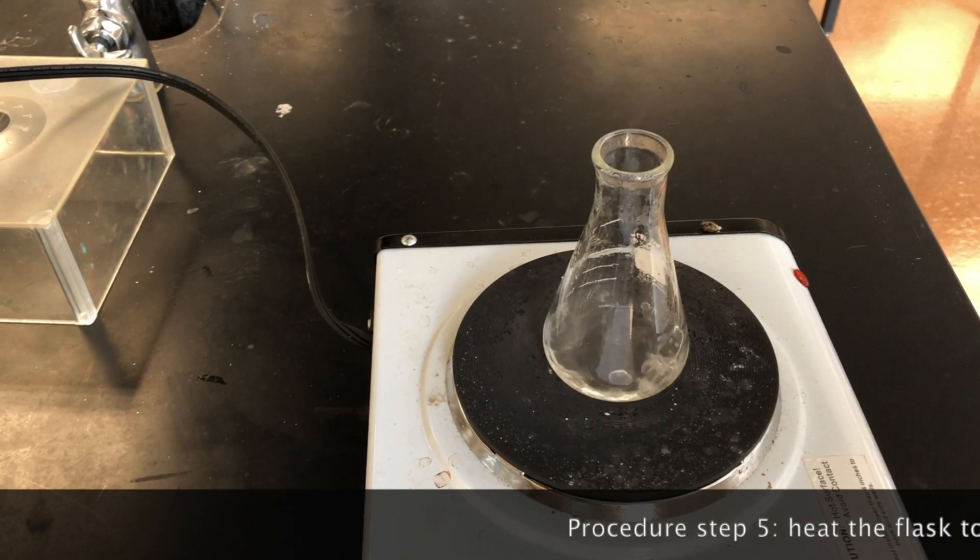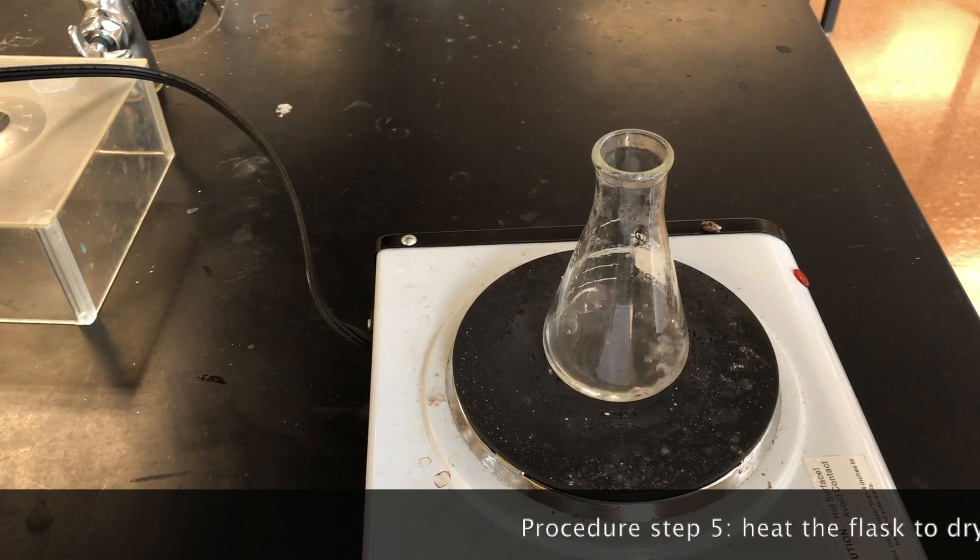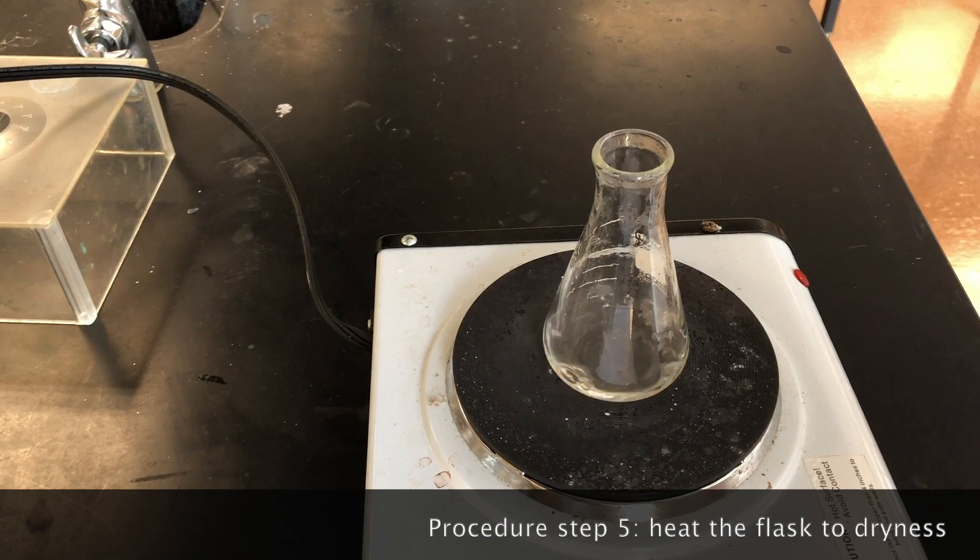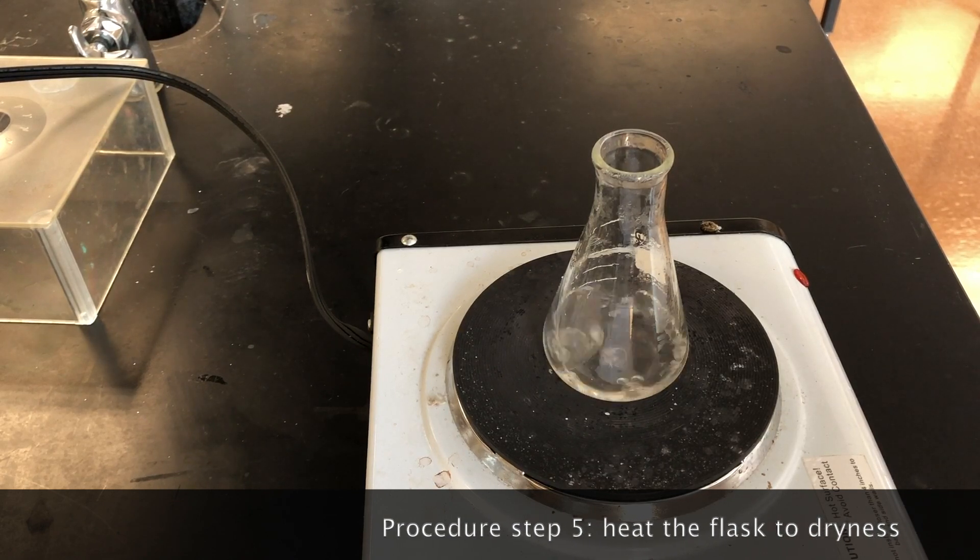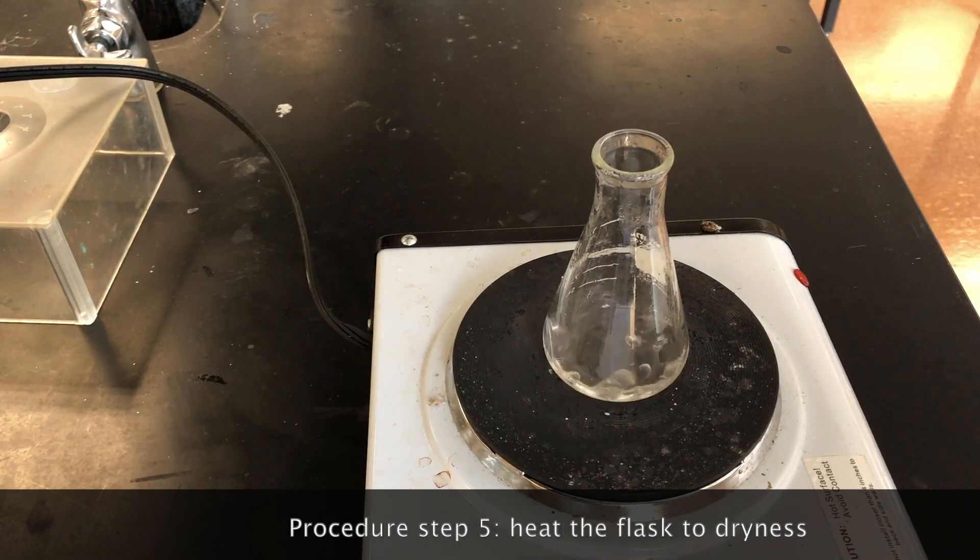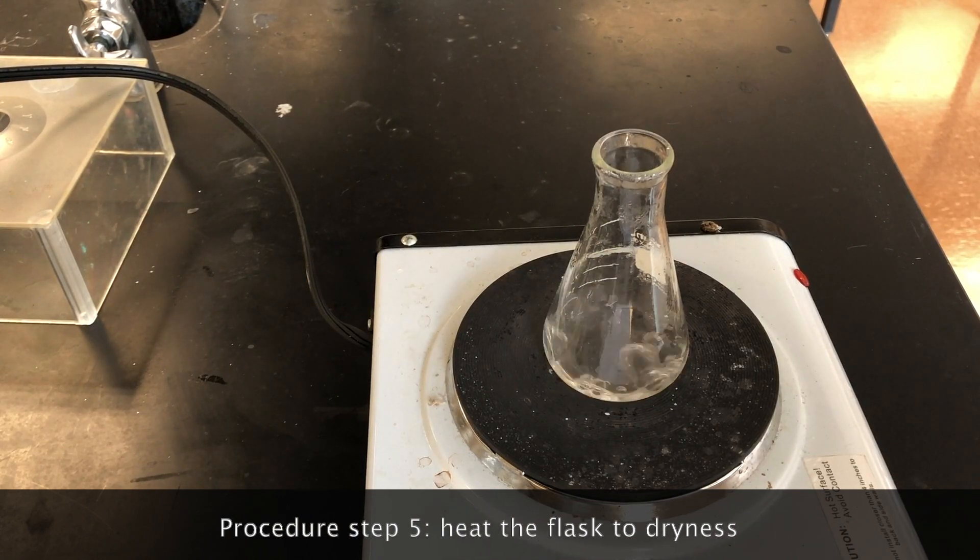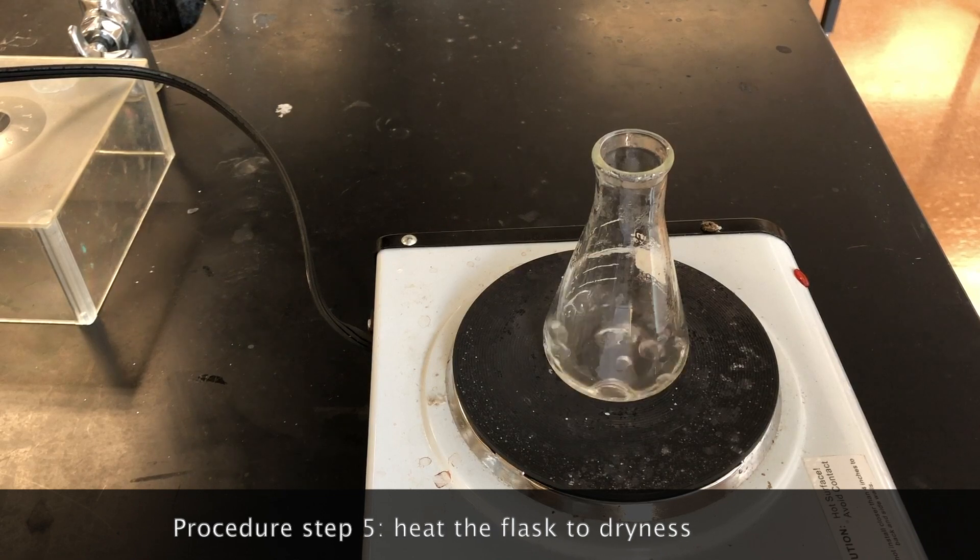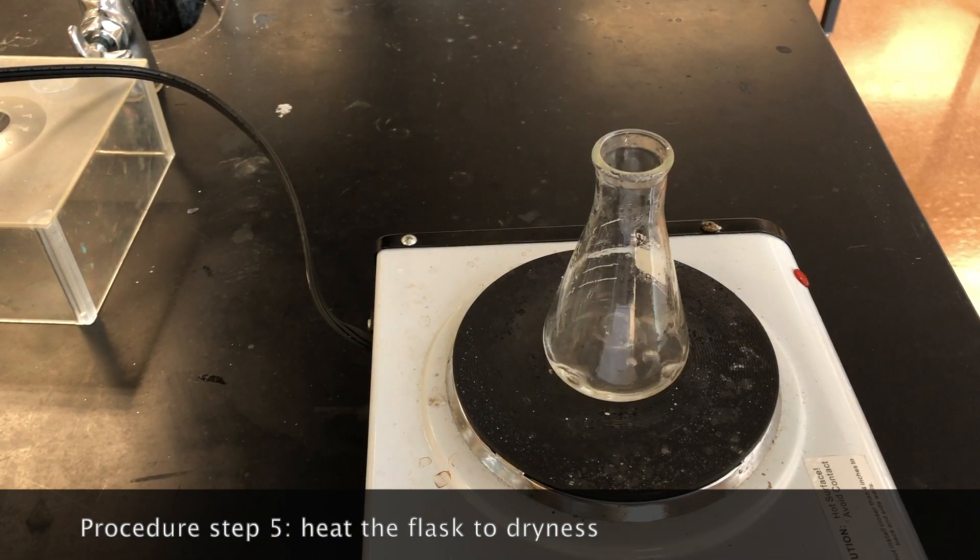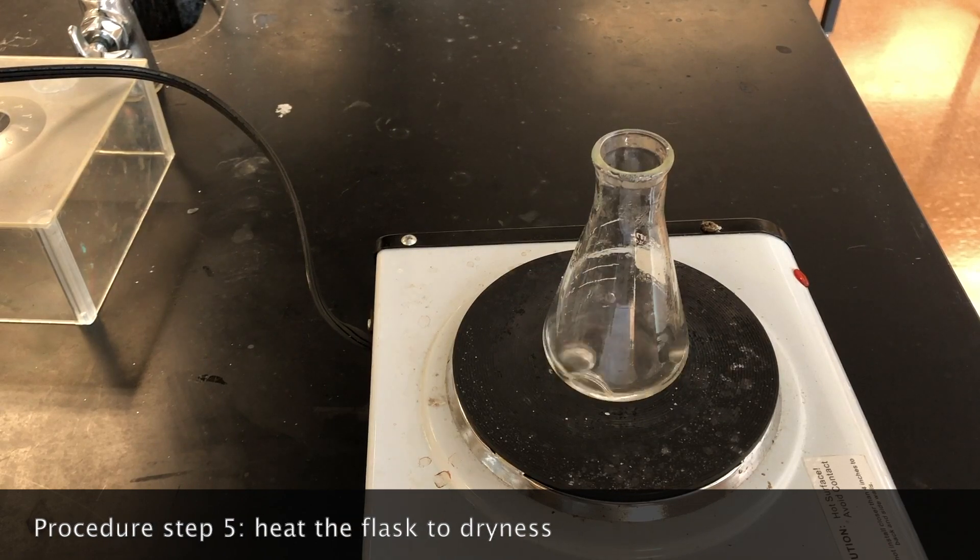This is the reason why we're doing this experiment in an Erlenmeyer flask and not a beaker. At this point, with a beaker, we would be losing too much due to bubbling over the water, escaping over the edge of the beaker. So we'll let this go for a couple minutes.